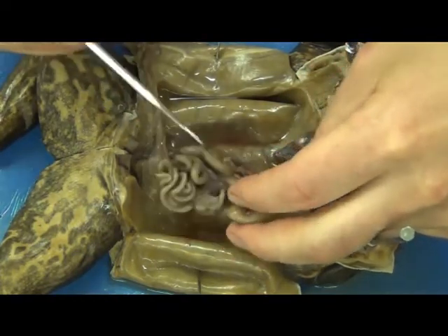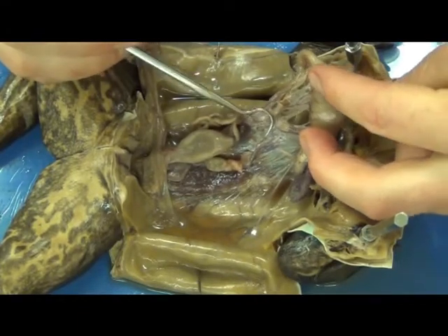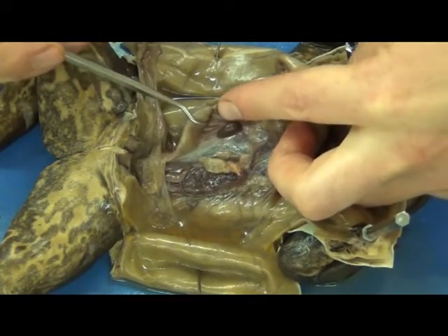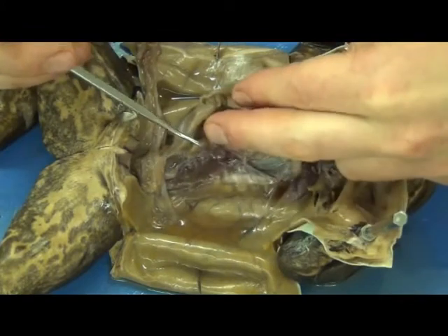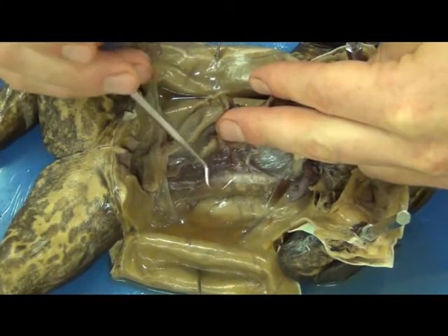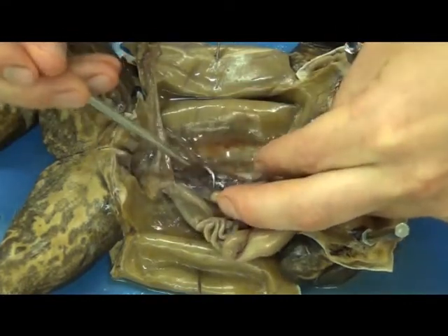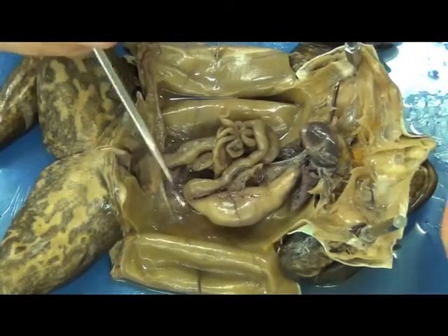You'll have a pancreas on the inside — this one is poorly preserved. Also nestled within all these membranes, you'll see a dark clump or dark organ, and that is the spleen. We removed the gallbladder earlier with the liver. Back behind all this, you're going to find two strange organs that are dark and flat, usually nestled one on each side of the spine back near what we'd call the back strap. And that right there is a kidney, and on the other side, its counterpart — the other kidney. That is literally the majority of your dissection.